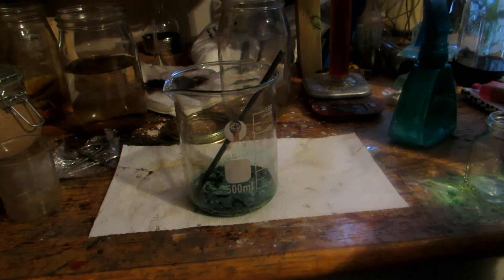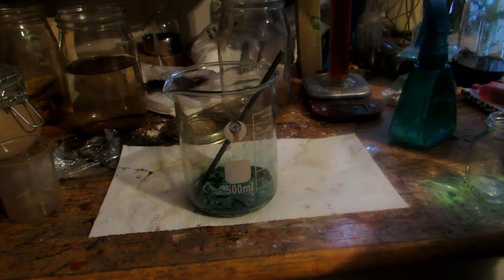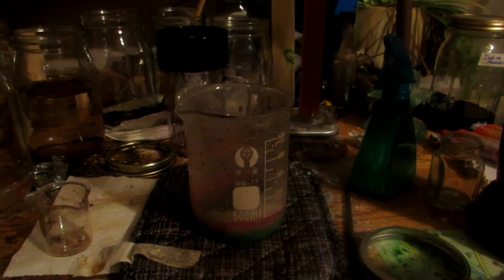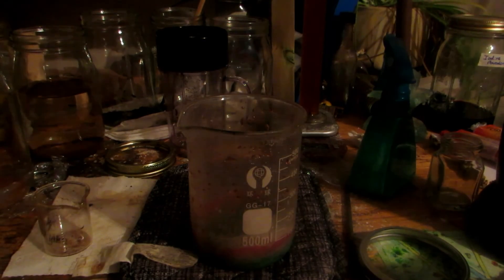I decided to add more water and re-boil it down. This can be done inside since it'll just be water vapor. I'd like to do this to clean up the crystals — and I really want the hydrated form because it's a nice purple color. If we re-boil until just a bit of liquid remains and let it cool, we should get nice crystals of the hydrated form coming out of solution.